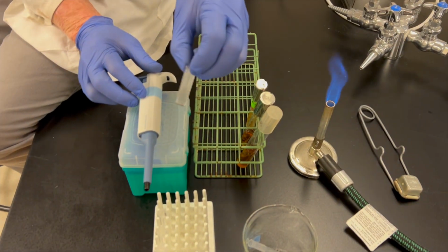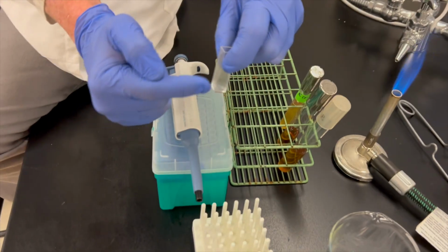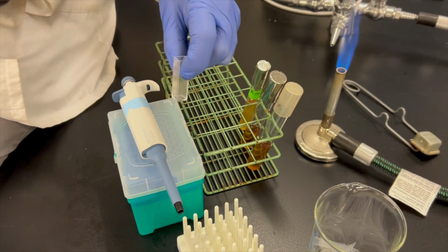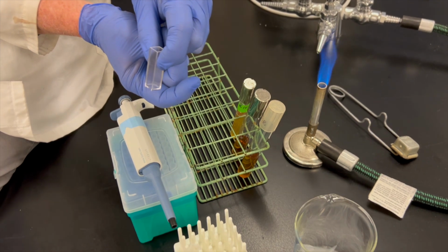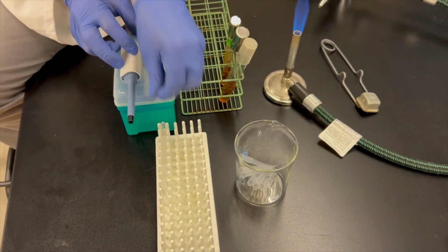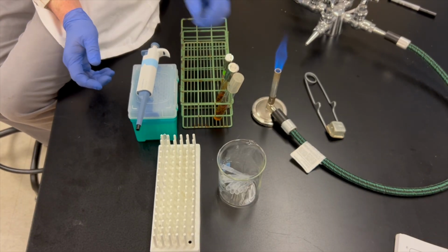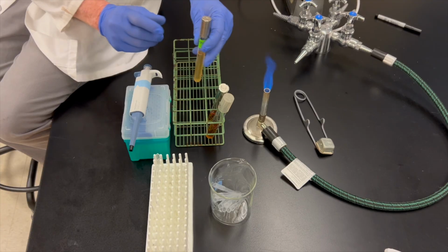Spectrophotometer then uses cuvettes. So these are called cuvettes. A spectrophotometer then takes light, shines the light through your solution. If there are any bacteria in here at all, then the light gets stopped by those bacteria and they don't make it onto the other side where there's a phototube. The amount of light that gets stopped is called absorbance. So the spectrophotometer then is going to measure absorbance, and it's going to tell us roughly, or relatively, how many bacteria there are in the tube.